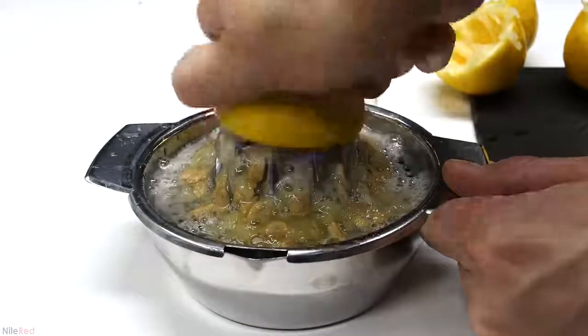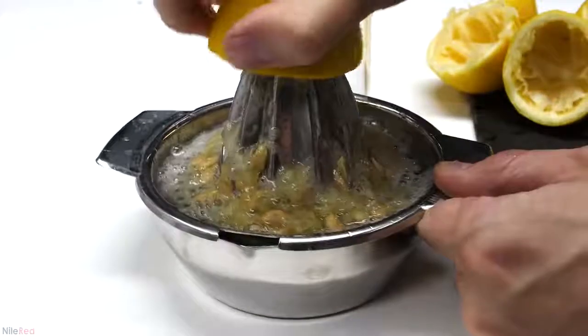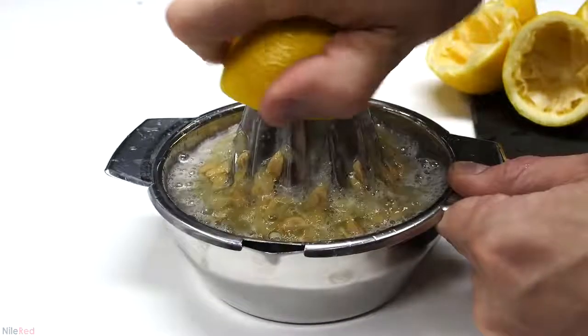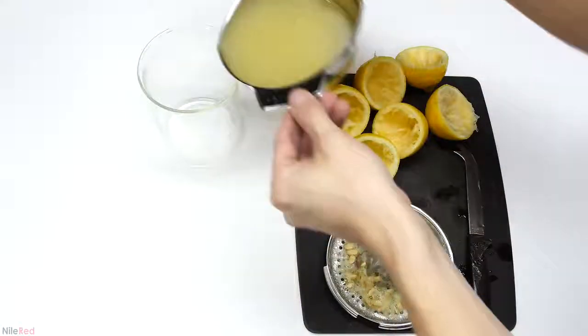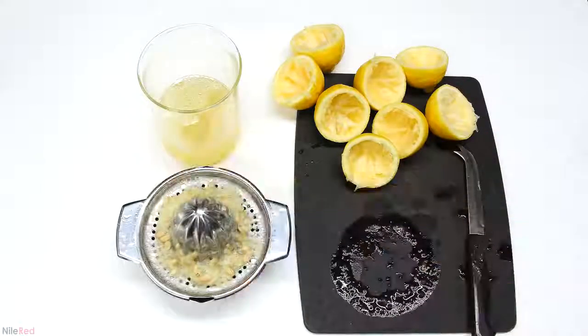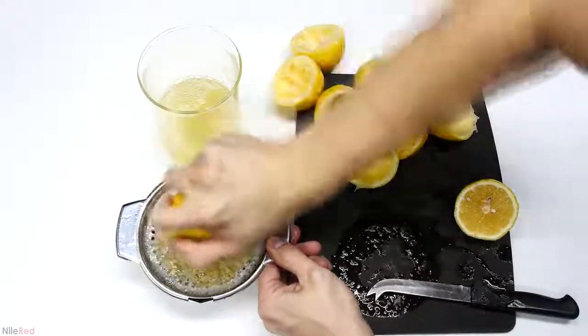The first step is to remove the juice from all of the lemons. I did this manually by chopping each lemon in half and then juicing it like you see here, but there might be an automated way to do this. I removed the juice from about 4 lemons, and at this point my juicer was full, so I had to empty it into a beaker. I then continued things by chopping up and juicing the rest of the lemons.